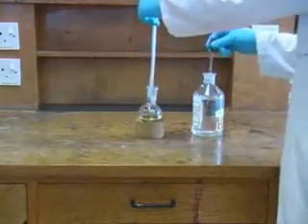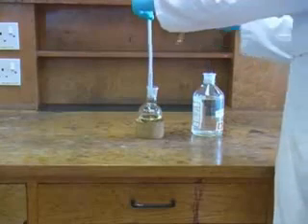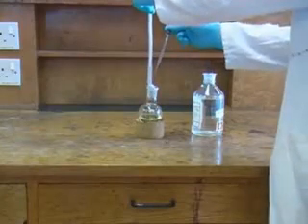The first step is to remove the magnetic stirring flea from the reaction flask. We need to wash this with ether to ensure that we don't lose any of our product.